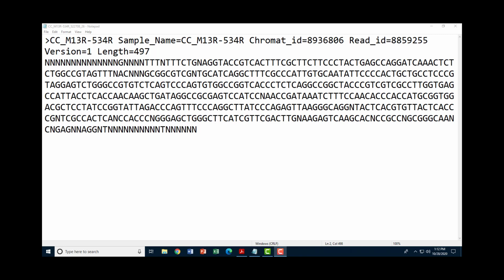Hello everyone. Today we're going to talk about how to deal with a messy sequence. You guys are soon going to receive your DNA sequences back, and you will receive a string of letters as you see here on the screen. Now you can see in various places there are many nucleotides that are listed. Like for example here we have G, G, G, C, C, G, T, G, T, C, T, C.